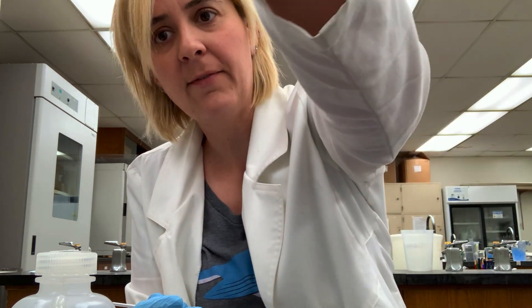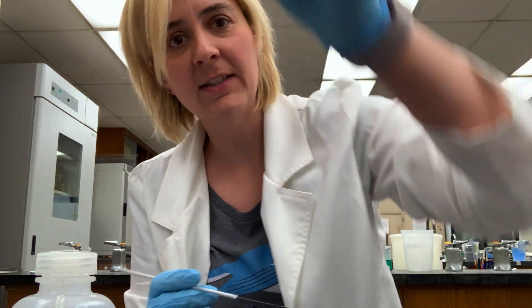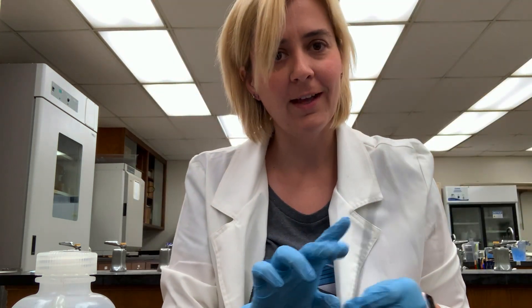Just like with every other stain we've done so far, I will let my slide air dry and then I will heat fix. Then we'll move on to the specifics of the acid-fast stain.